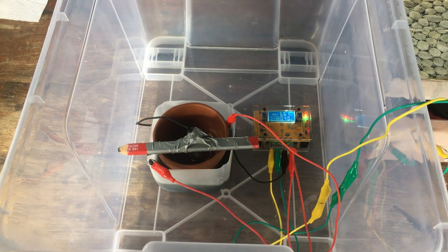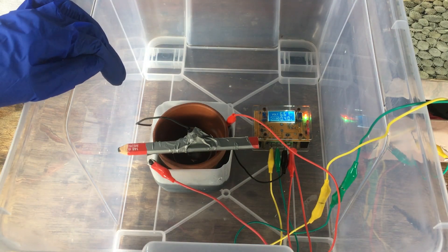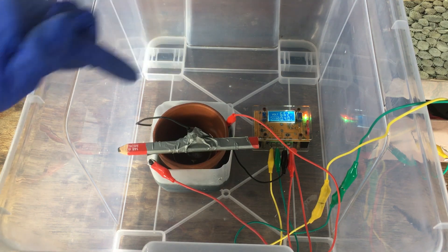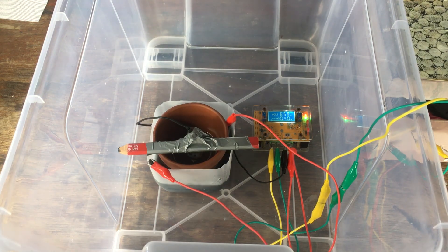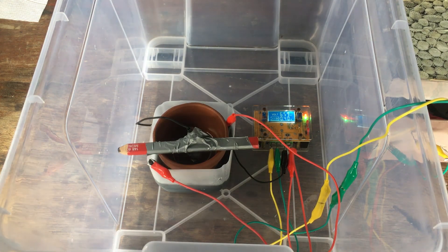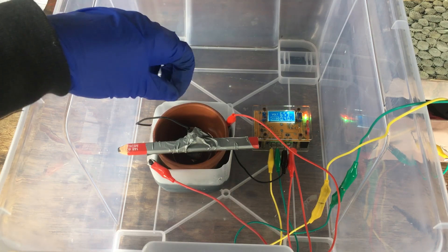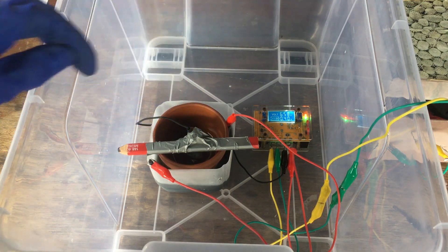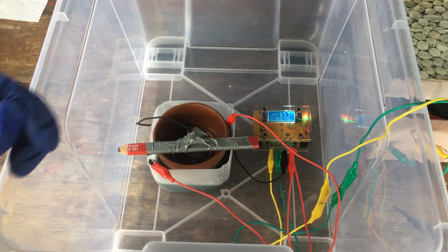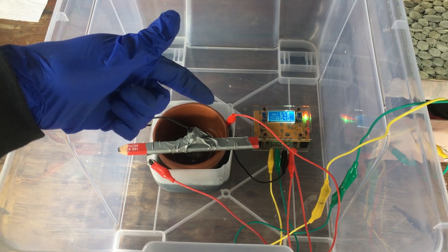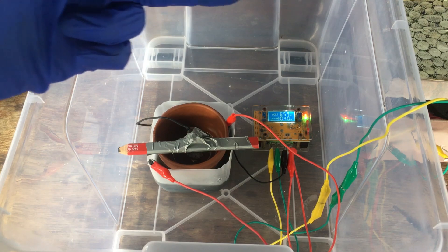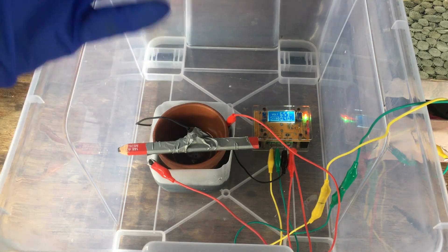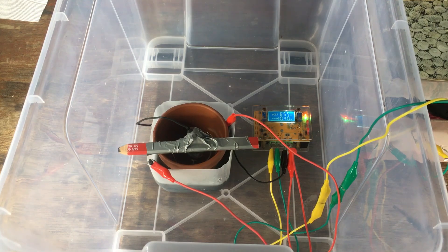Okay, two days on, and I have some bad news. I have not been able to get a thick coating of manganese to plate onto our titanium cathode, I'm afraid. Over the past 48 hours, I've tried many ways to try to actually get our metal plating onto the cathode. I've tried low current density, I've tried high current density, I've tried making the catholyte acidic, I've tried making the catholyte neutral, none of which seem to give reliable results.